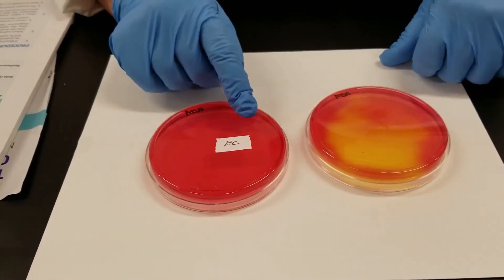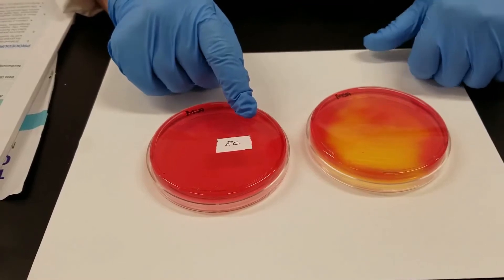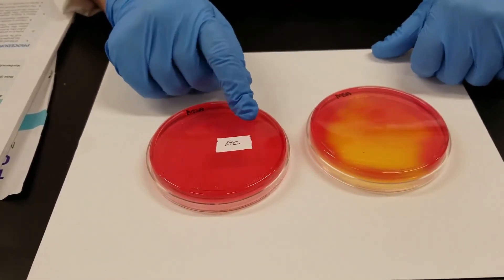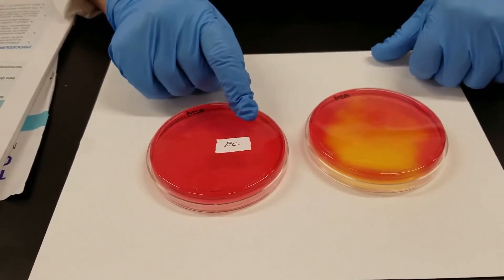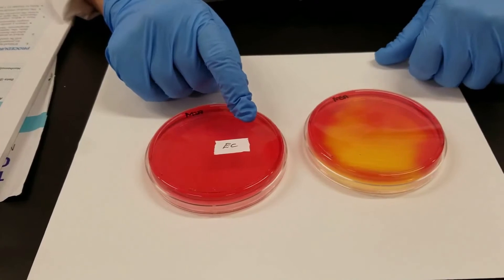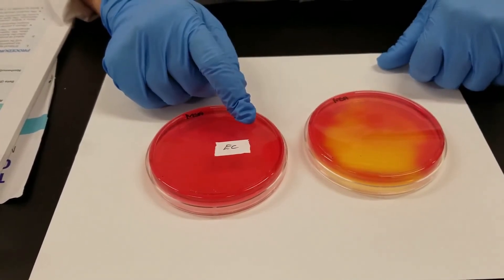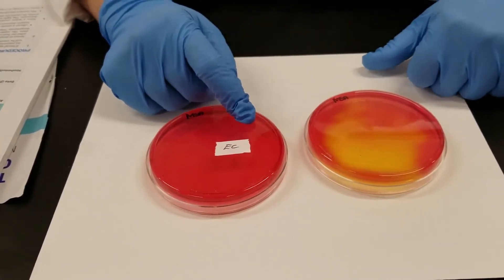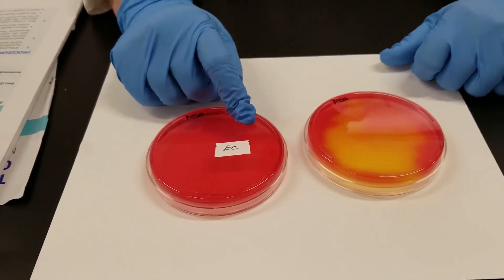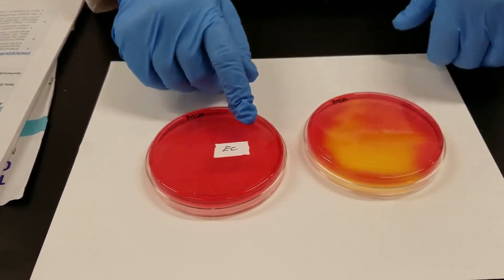Over on this plate, this is what the plate looked like initially prior to inoculation. This one was inoculated with E. coli and you can see there is no growth. It cannot tolerate the salt, so that is selective and inhibited the growth of it.